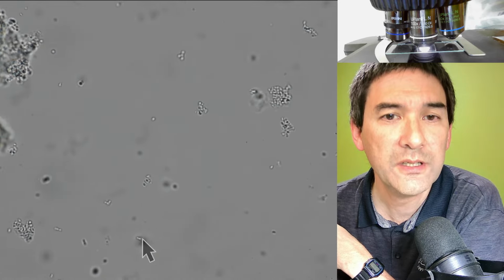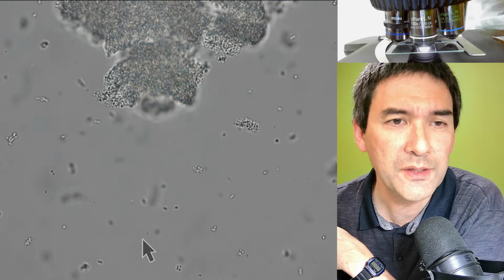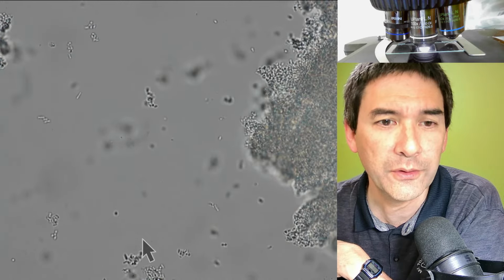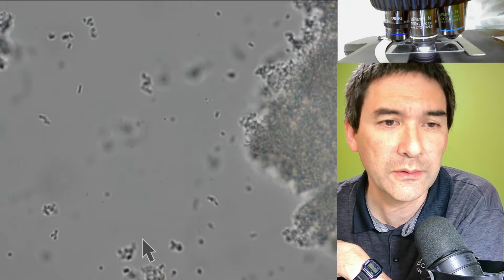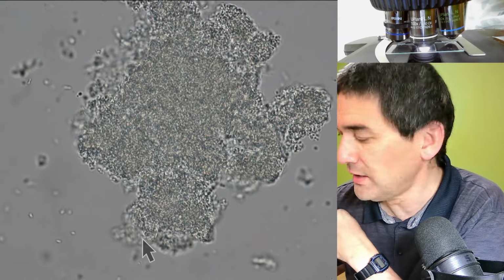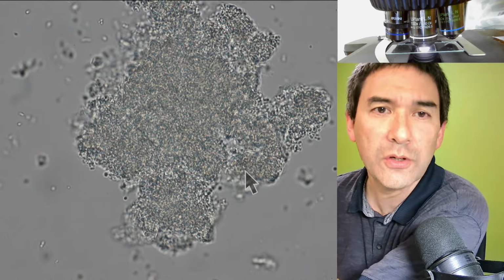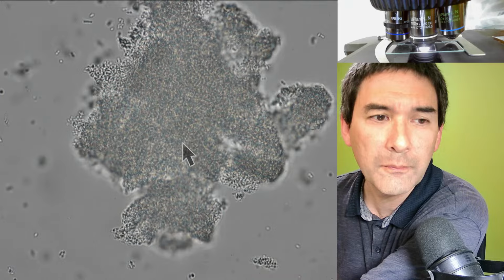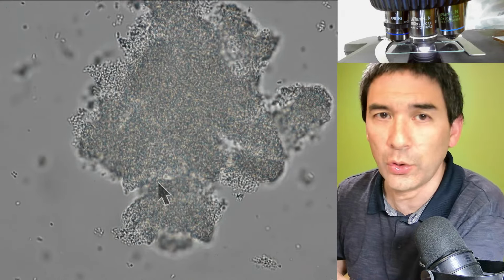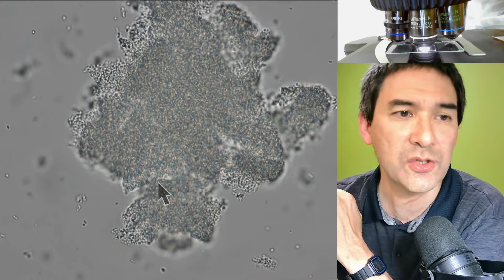Here we go. These are basically yogurt bacteria of, I think, three different species, and depending on which type of yogurt you want to make, you can buy different freeze-dried yogurt bacteria. Over here on the side, these are still clusters that did not dissolve yet. But occasionally those bacteria are starting to break free, and they're moving around not on their own in this case, but because of capillary action, and also because the oil is exerting a little bit of pressure on the cover glass.